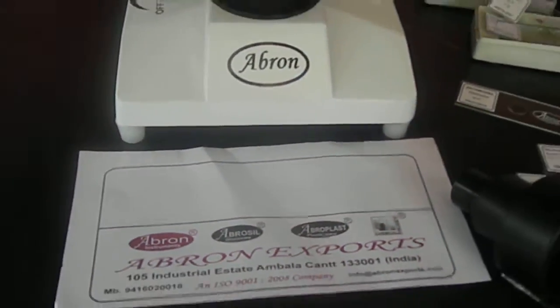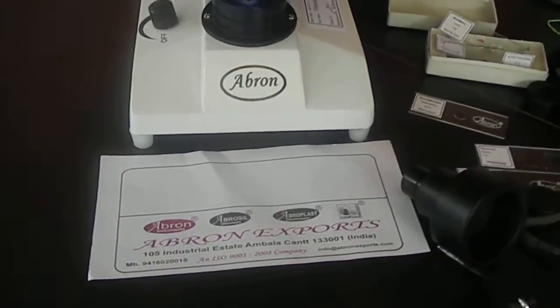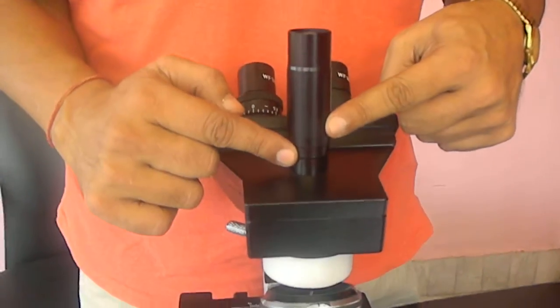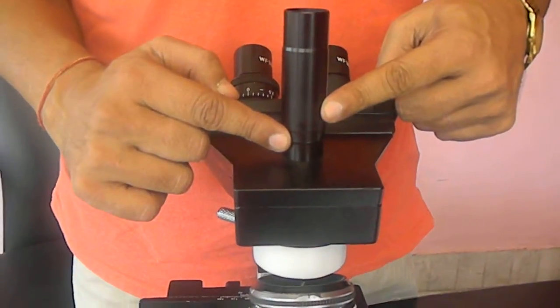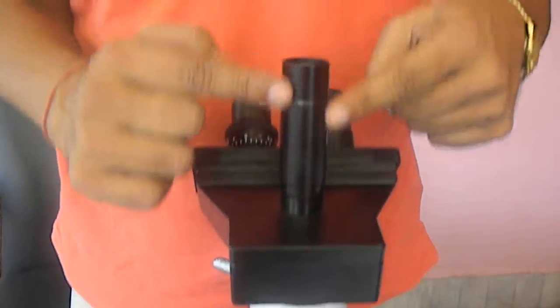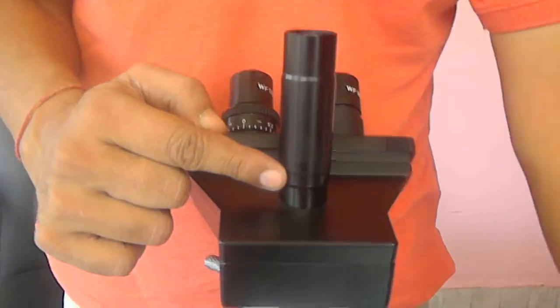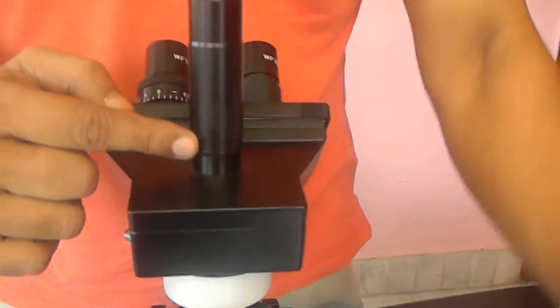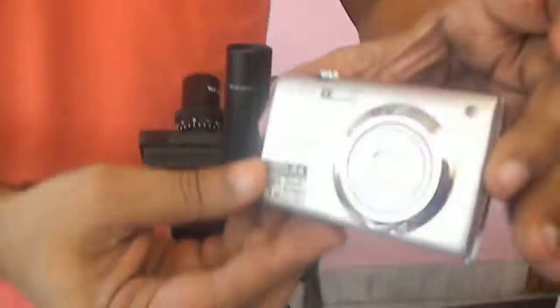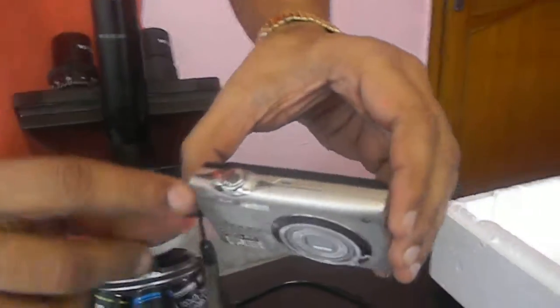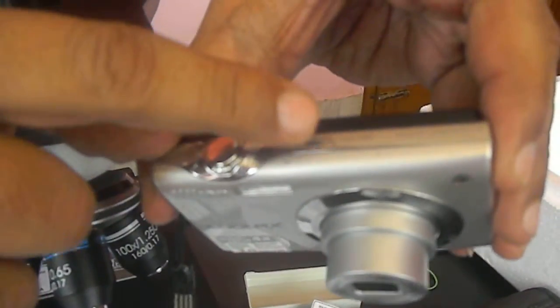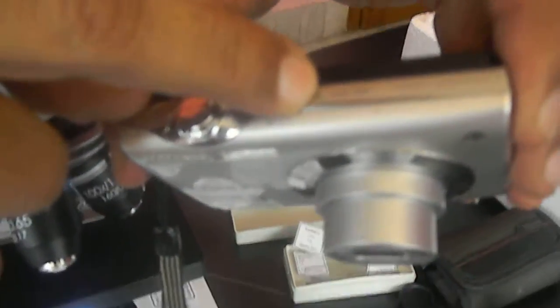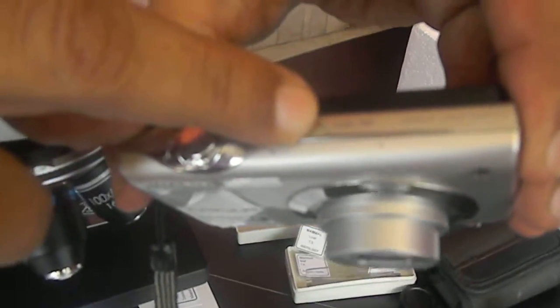Now let us learn how to fix the camera. First of all, fix the trinocular microscope vertical one trinocular tube. Then the camera is there. It has an on-off switch here which on it automatically zooms out. Then you switch it off.